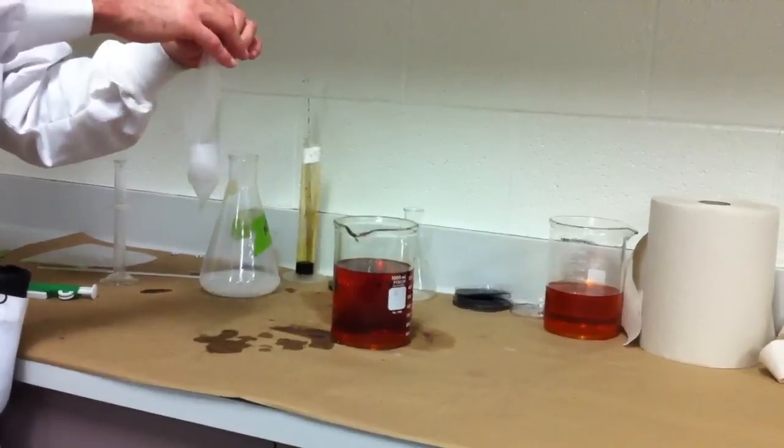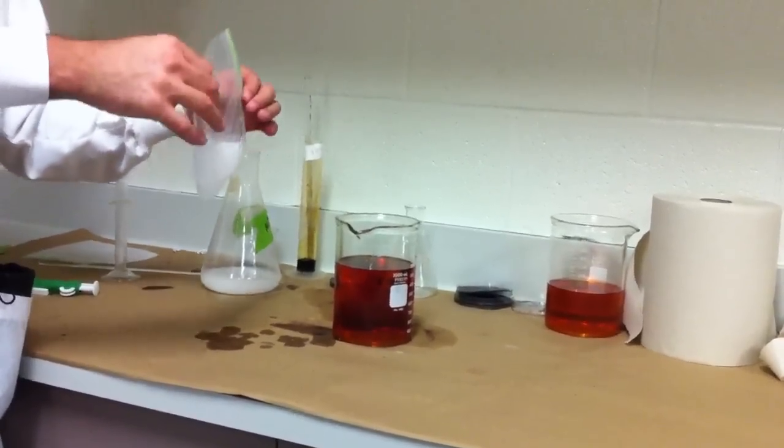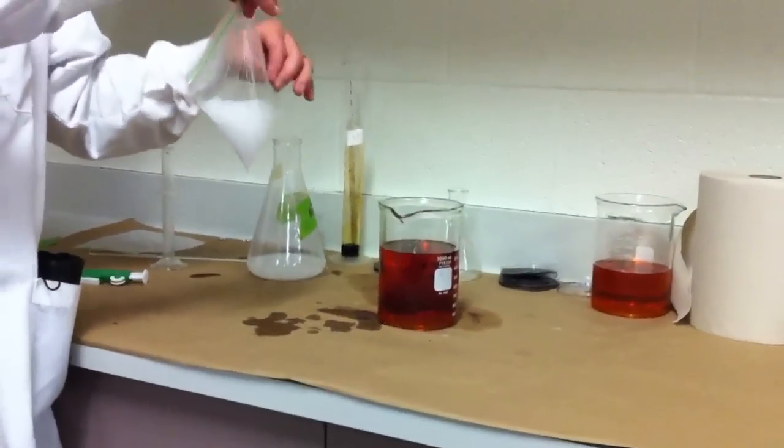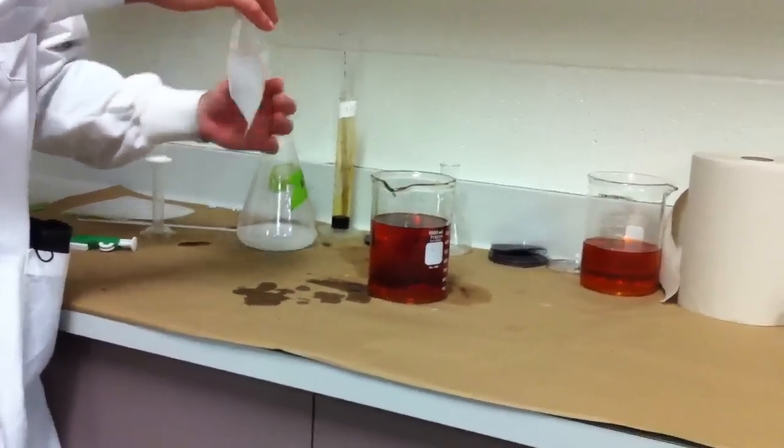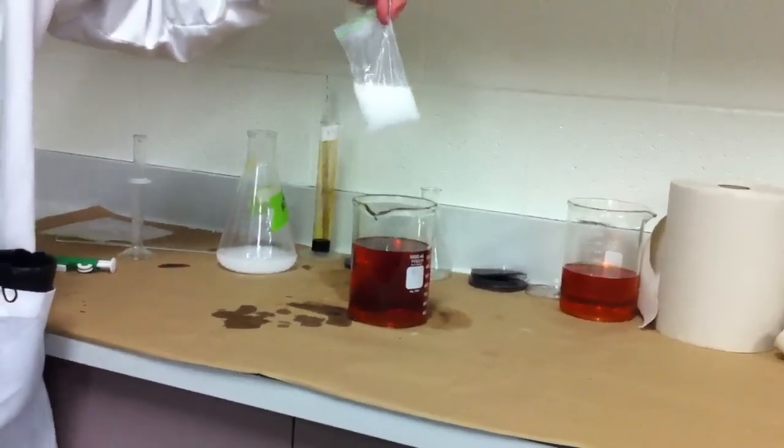Let's make sure this one's not leaking because that's important to the experiment. We have to stop if it's leaking. So this one okay? Looks all right? Yeah. Sealed up? Good? Yep. Okay. So I'm going to put this into the iodine solution.